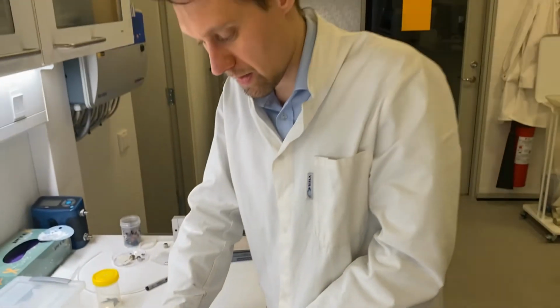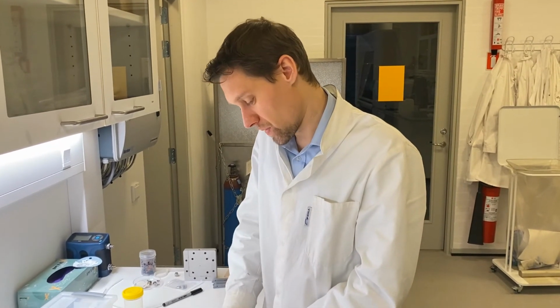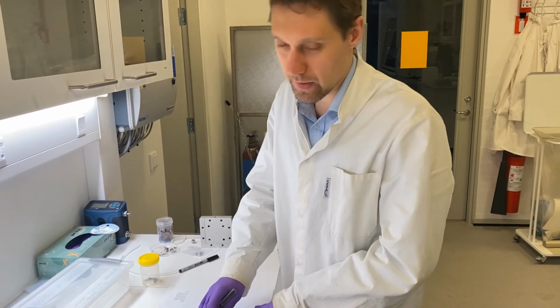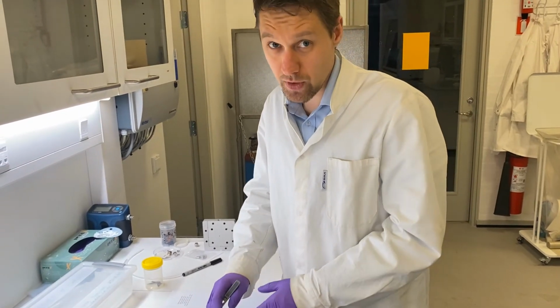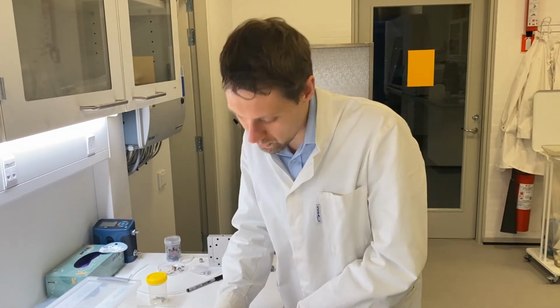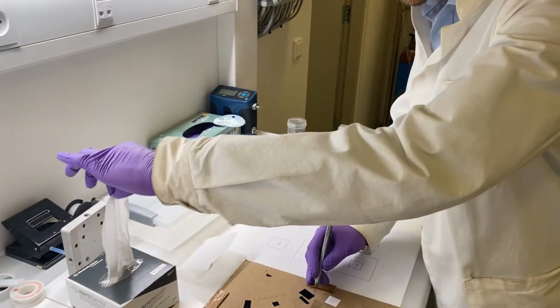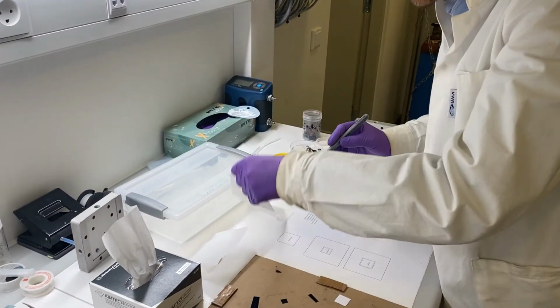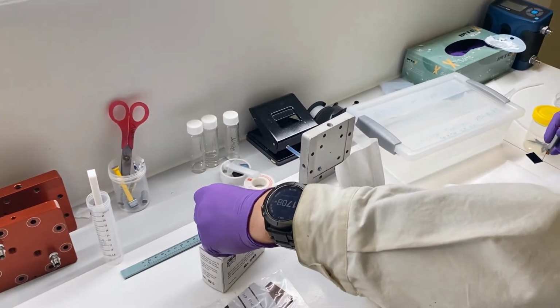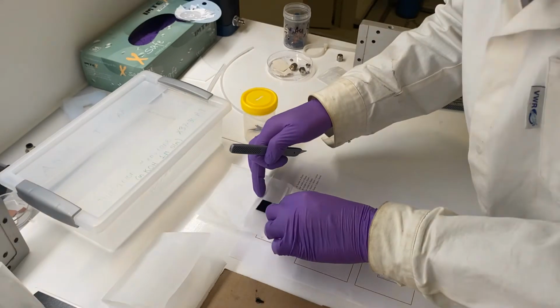Now, the anode is in principle as fragile as the cathode. It's made in almost the same way, but as it's going to be, you could say, submerged into electrolyte, it's not as critical to keep the hydrophobicity of it. So you can actually puncture it if you want to, moving it around. Again, you want to avoid getting any dust on it, so we'll use the same trick with a piece of dust-free paper here, and then store it here.